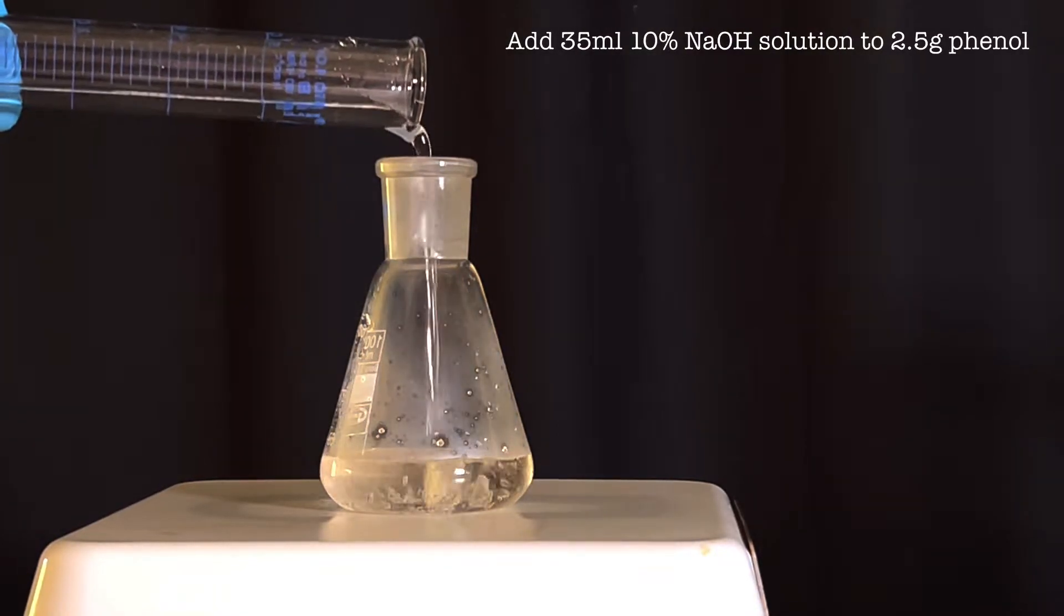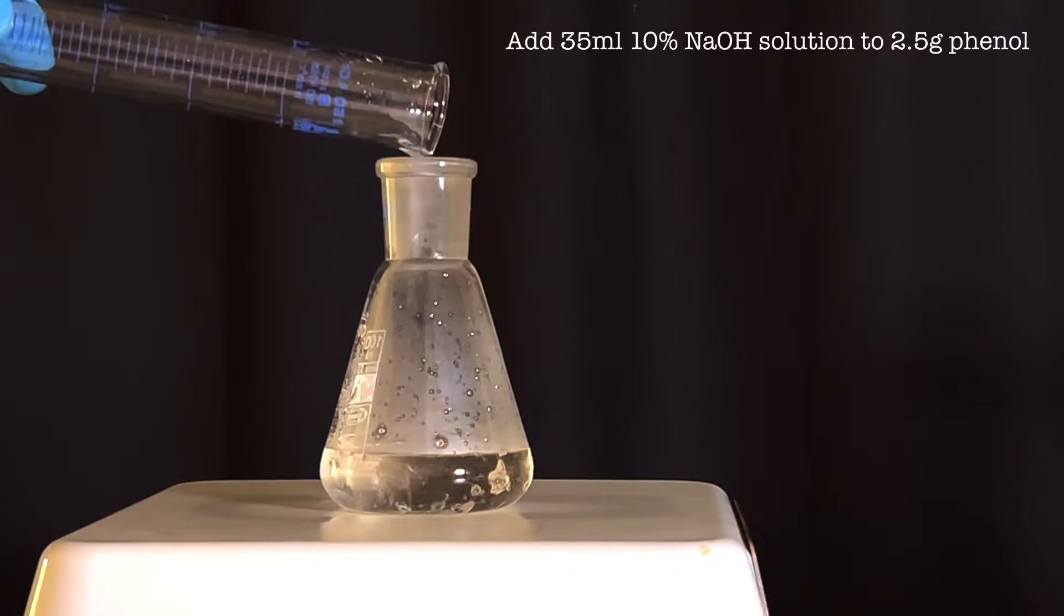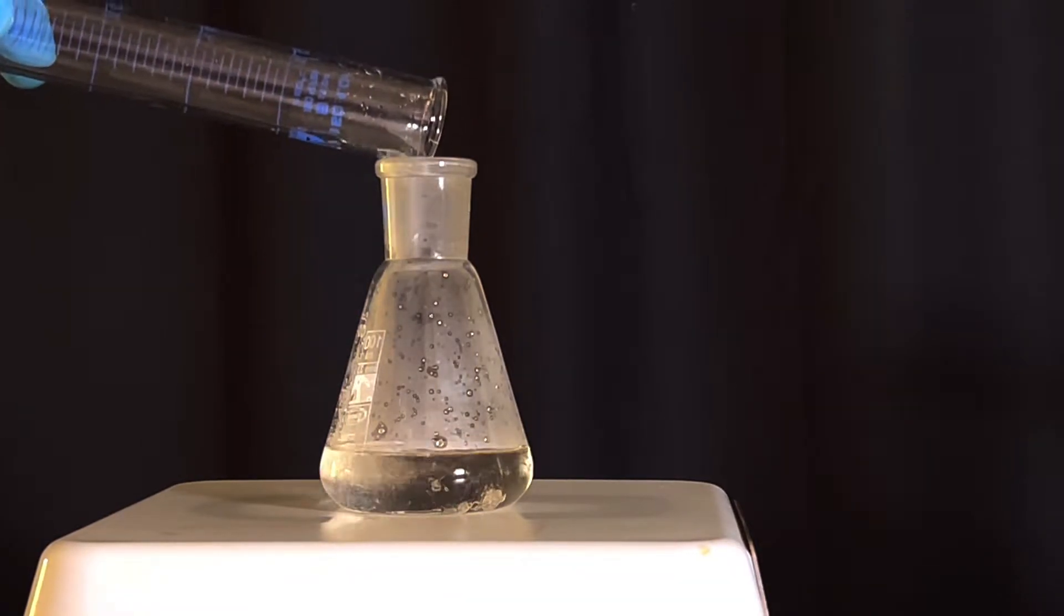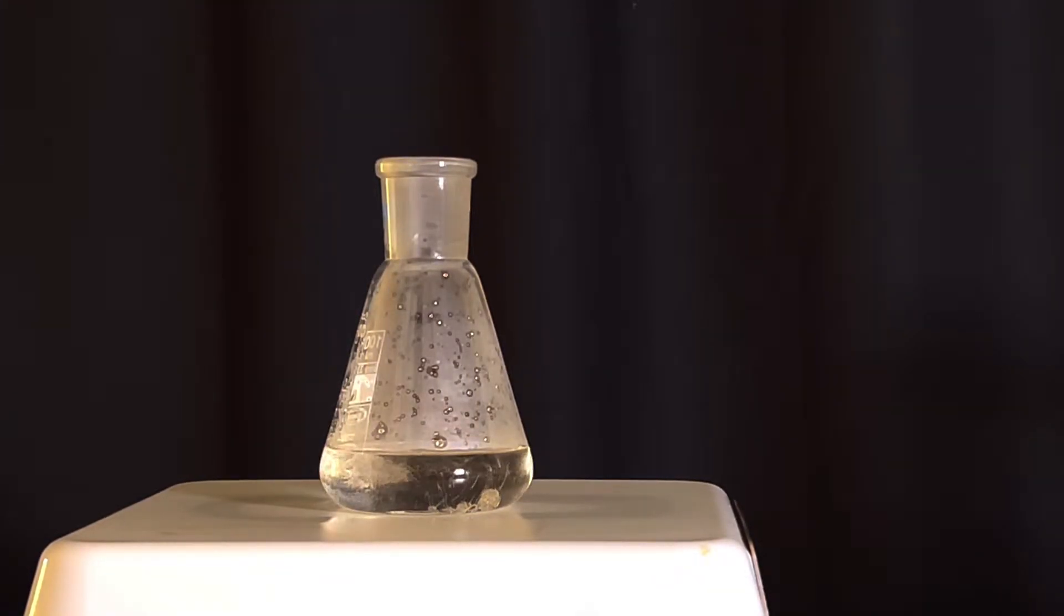35 milliliters of 10% sodium hydroxide solution was measured in a graduated cylinder and was added to the phenol. Mix well so that the phenol dissolves in sodium hydroxide.